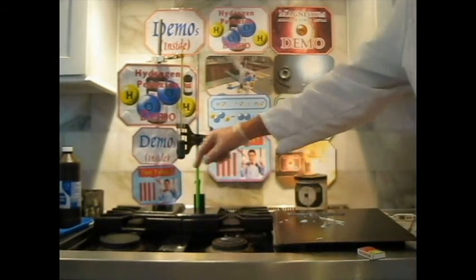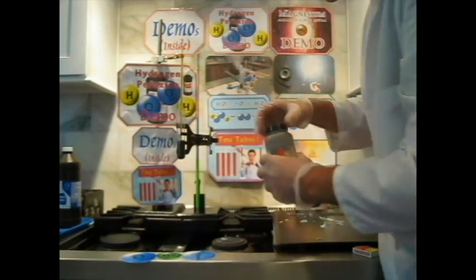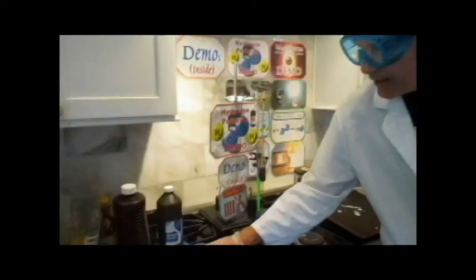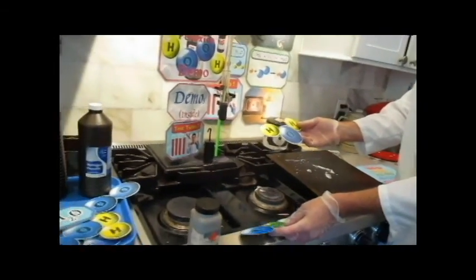And what's left in there is actually the catalyst, because catalysts are not directly involved in the reaction. Catalysts are still in there, and water. So if we used up all the hydrogen peroxide, then what we really have left in here when this is done is water and the catalyst floating around. It should settle on the bottom. So in a few minutes I'll get another shot of it after it has settled out on the bottom.